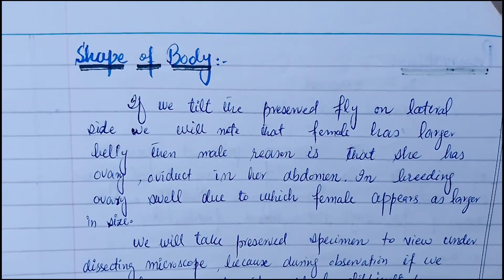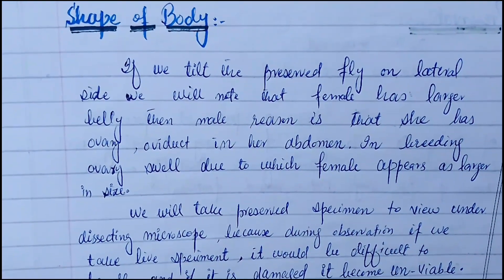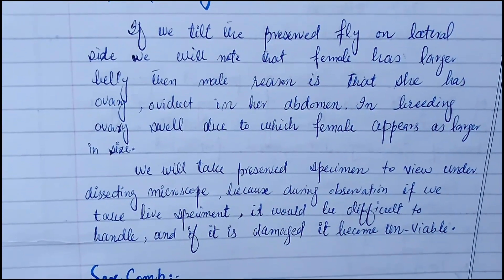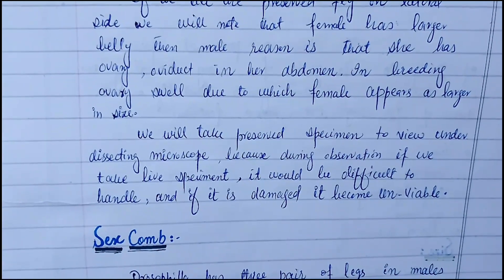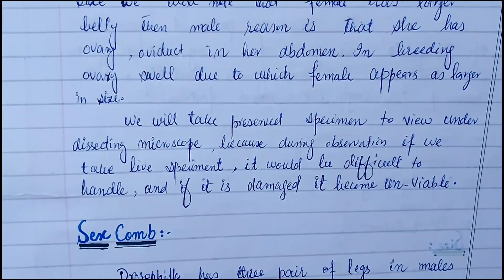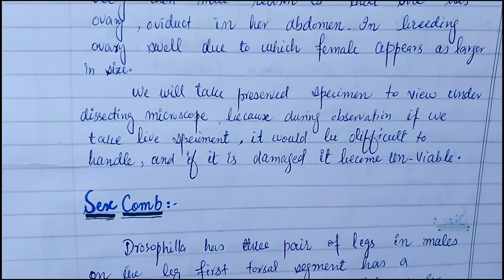If we tilt the preserved fly on the lateral side, we will note that the female has a larger belly than the male. The reason is that she has ovaries and oviduct in her abdomen. During breeding, the ovaries swell, which is why the female appears larger in size. We will take preserved specimens to view under the dissecting microscope, because if we take live specimens, it would be difficult to handle, and if damaged, the specimen becomes unviable.